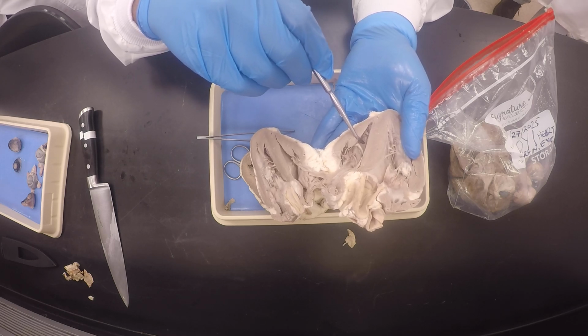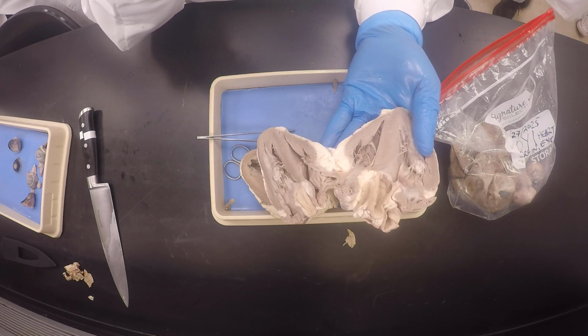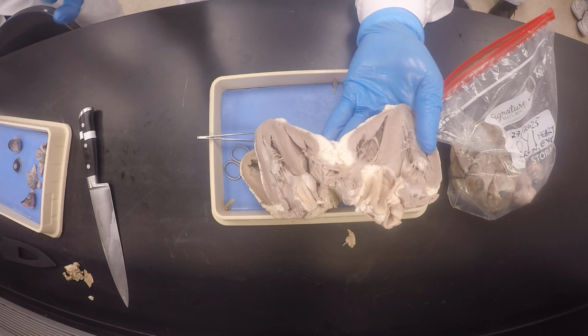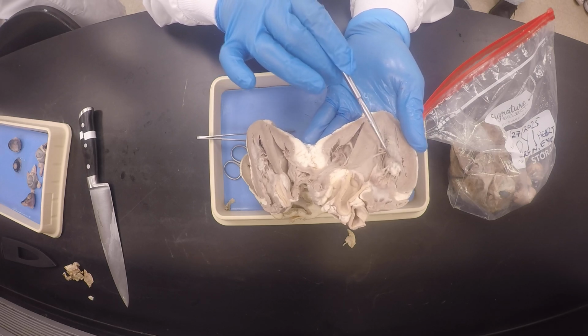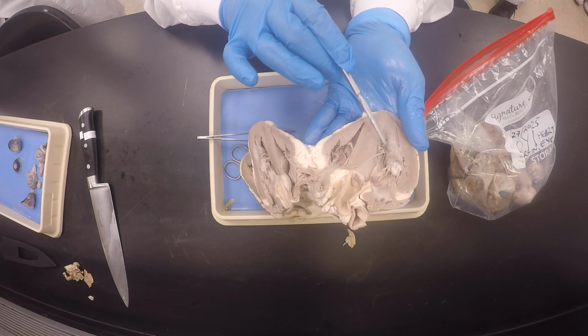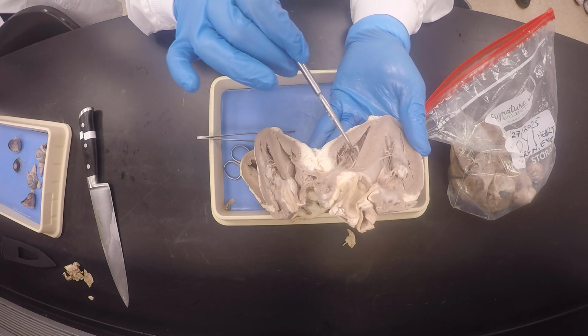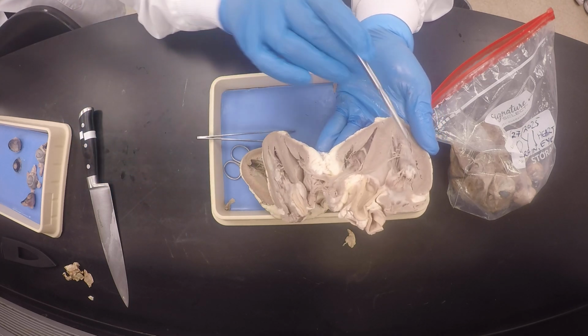The right ventricle is not a smaller chamber as such, but it has a much thinner myocardium. You understand? So it makes sense that the trabeculae carneae, which are these ridge-like muscular tissues, are more prominent in the left ventricle than the right, because it is much thicker.